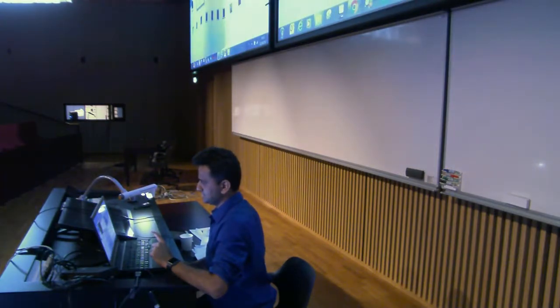So if you go here, image, color, split channels, and then if you just go here, stacks, tools, combine. I want to combine it vertically. Not really combine. You see here now?